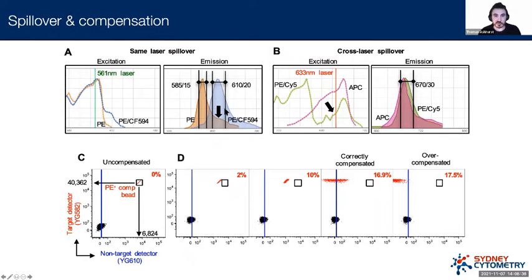So these are neighboring fluorophores. They emit very close together and they spill into each other's optical detectors on the machine. And so this is kind of the fundamental problem that we have to deal with. We're getting false positive contaminating signals is the easiest way to think about that. Now, what happens here is that this is one laser, which is kind of exciting both fluorophores optimally, and they emit in kind of areas that are near each other.